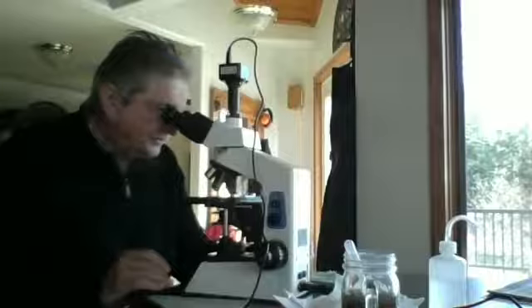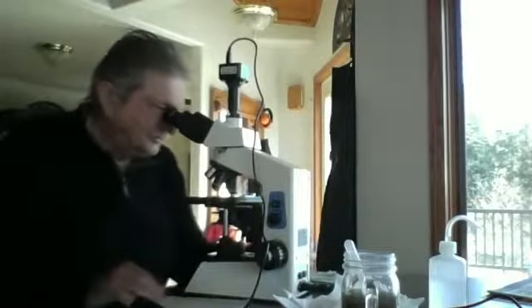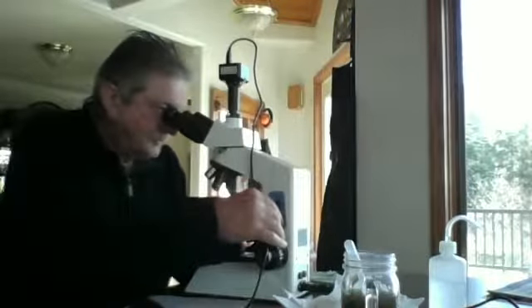And I have previously set up the microscope for diopter adjustment and condenser adjustment with a piece of paper. So now I'm on the field of view 1 and reading 1. I'm going to increase my light intensity.